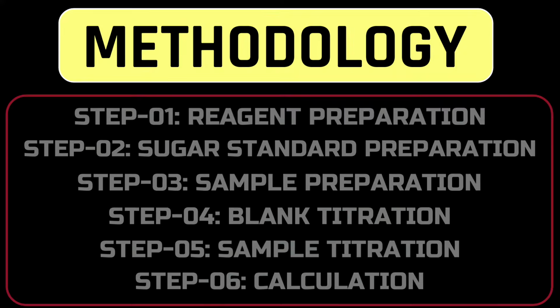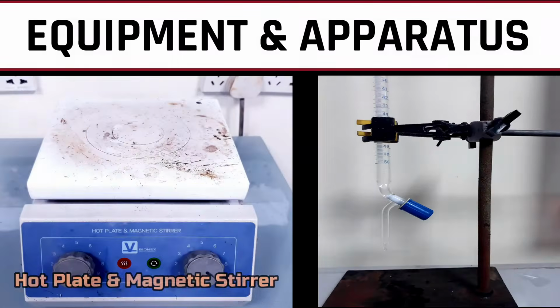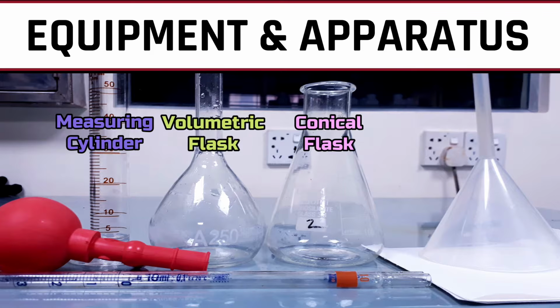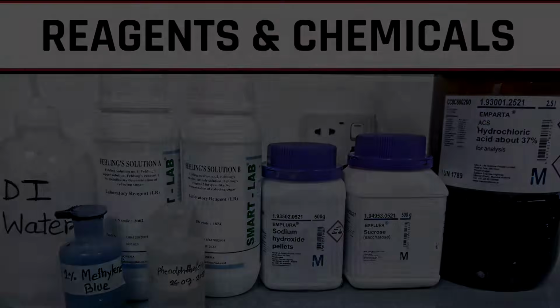sample titration, and calculation. To conduct this procedure, we need a balance machine, water bath, hot plate with magnetic stirrer, burette with stand, measuring cylinder, volumetric flask, conical flask, funnel, pipette with filler, filter paper, deionized or distilled water, Fehling solution A, Fehling solution B, sodium hydroxide, sucrose, concentrated hydrochloric acid, methylene blue, and phenolphthalein indicator solution.